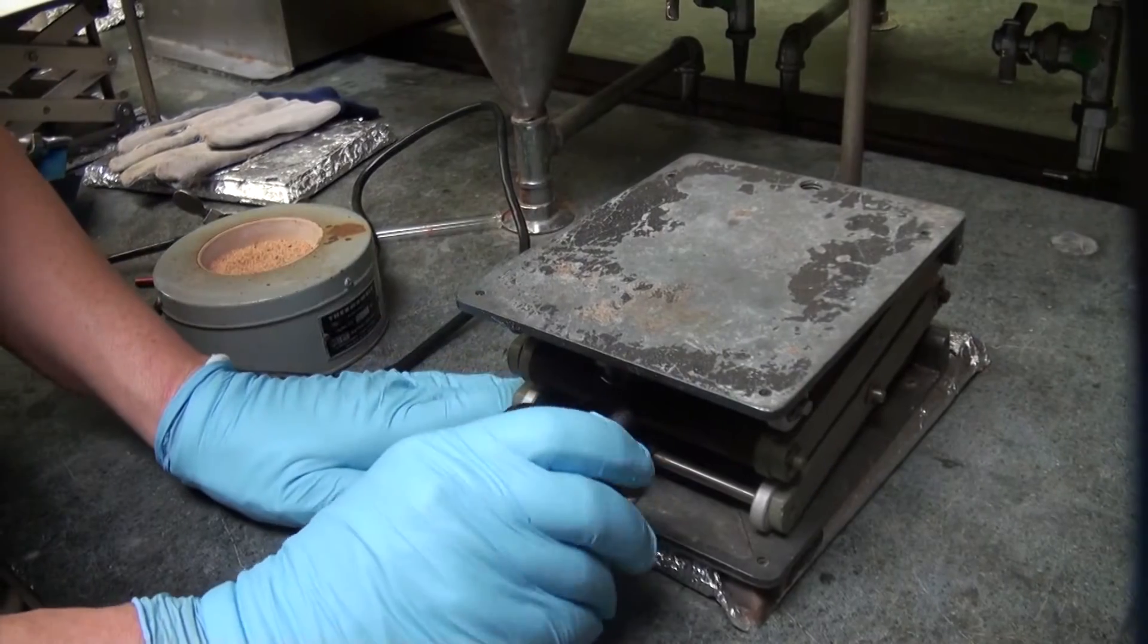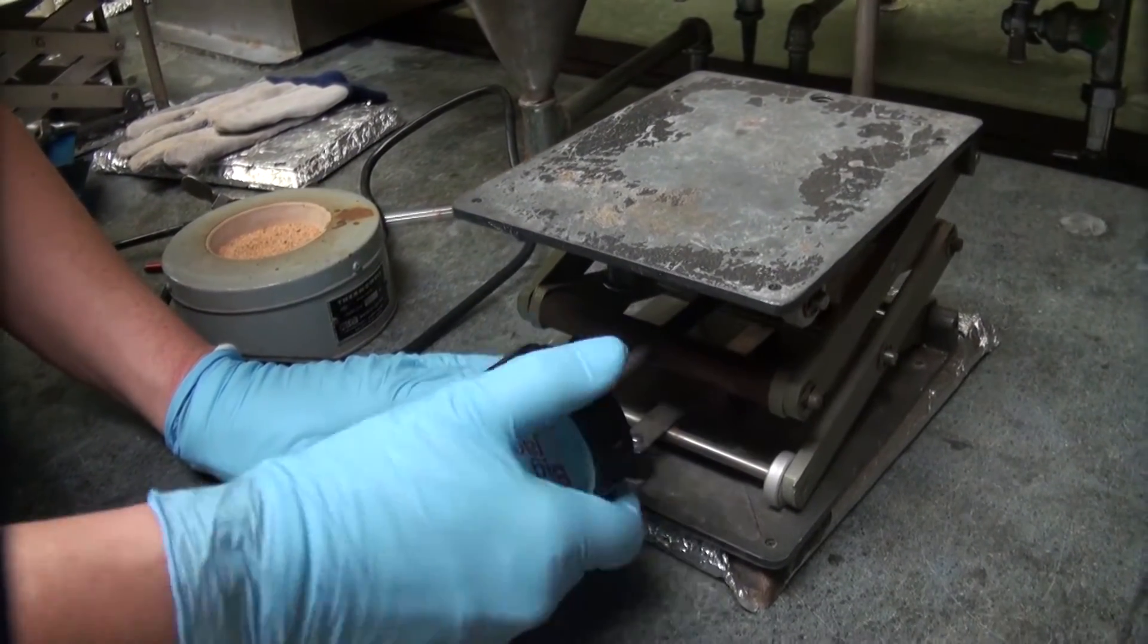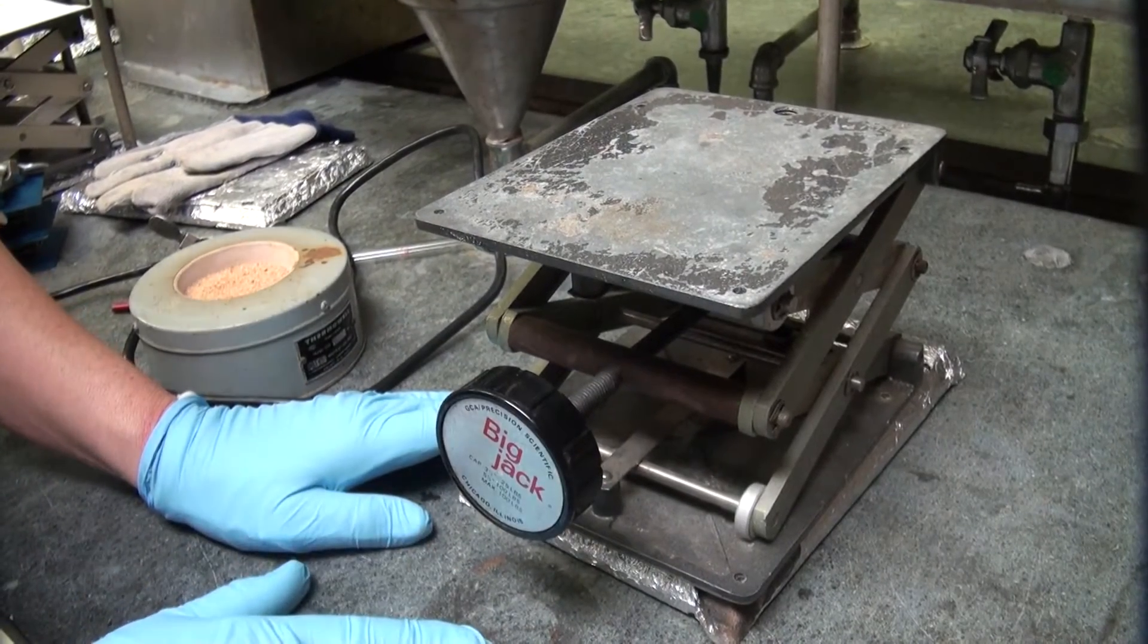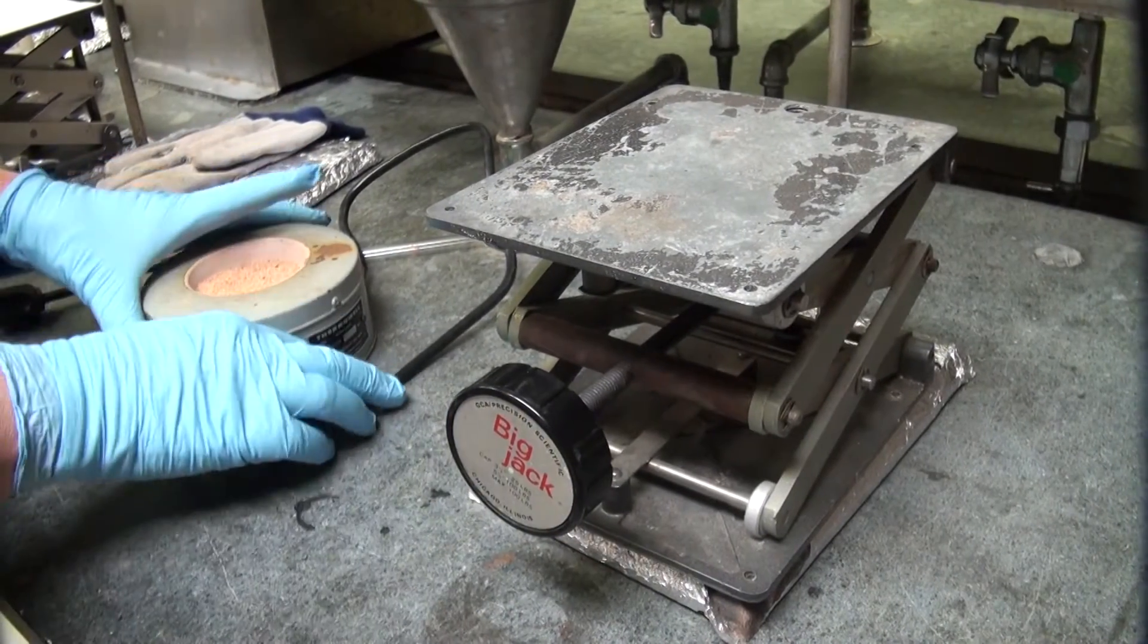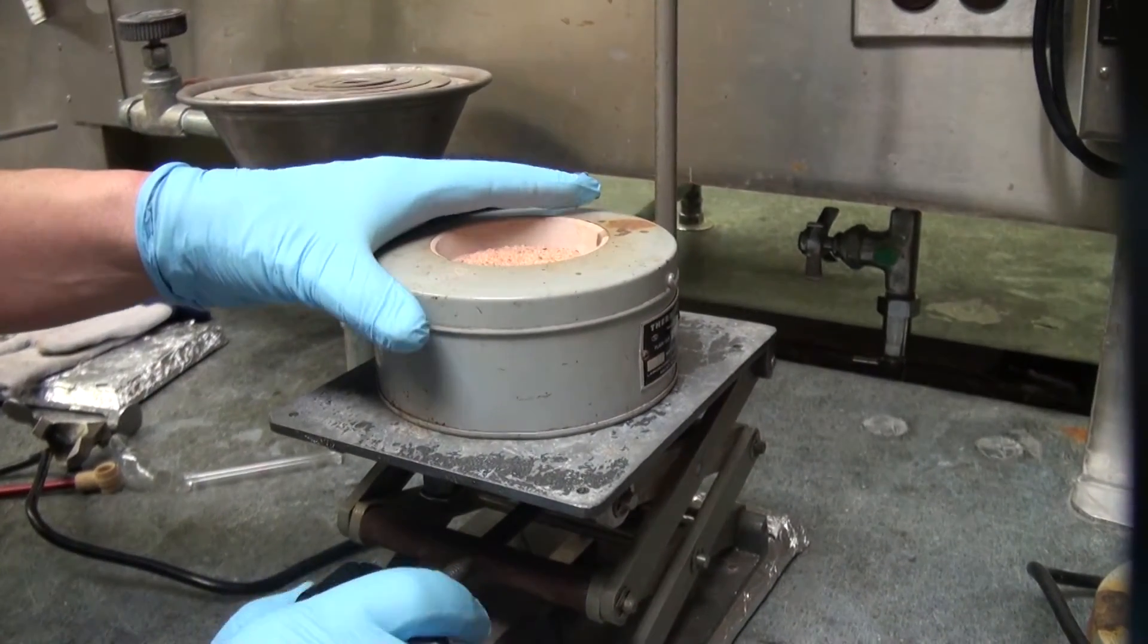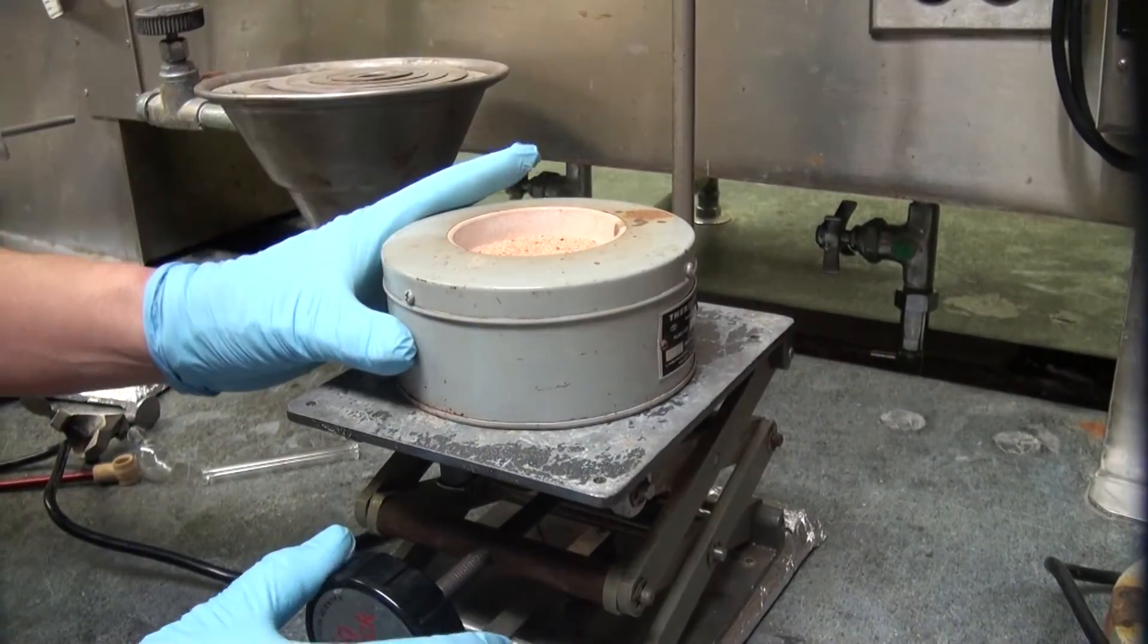Make sure it is lifted up because you want to be able to lower it down if something is going on or not going on in the right direction. You want to be able to lower it and remove the heat source from the reaction mixture.